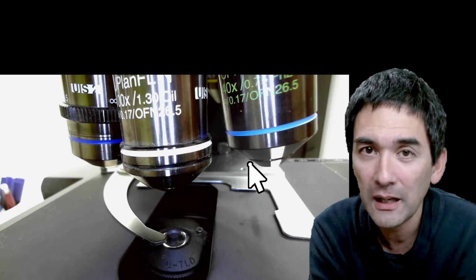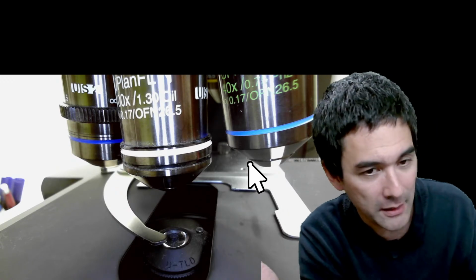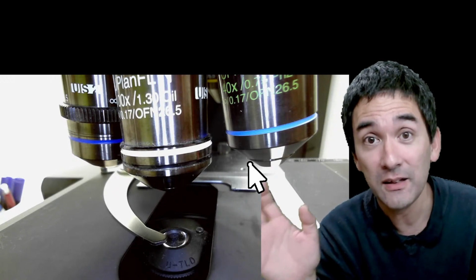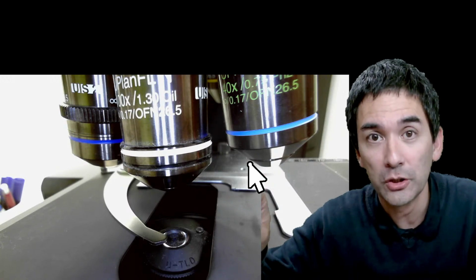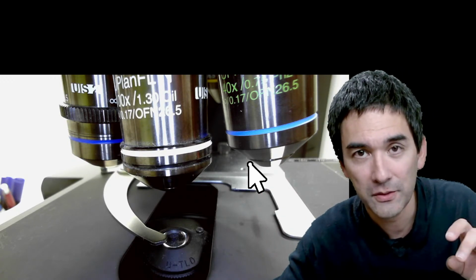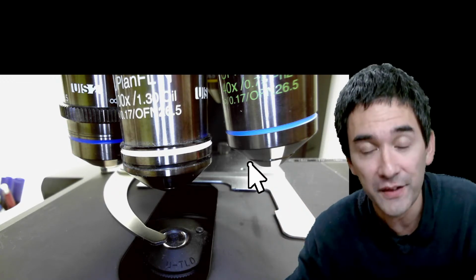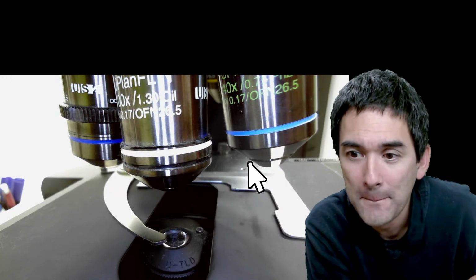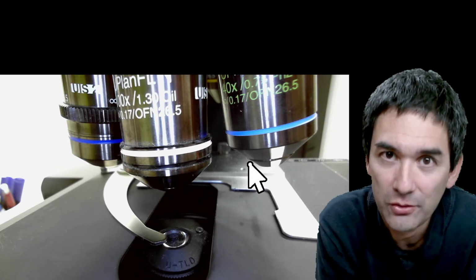With LEDs, I would say it depends a lot on which type of LED you have. For example, my microscope was advertised as having LEDs, but a special one which looks like natural light, like halogen. So in other words, the color reproduction of stains is as authentic. This was something they were specifically advertising. So I would say it's a question of taste to a certain extent.